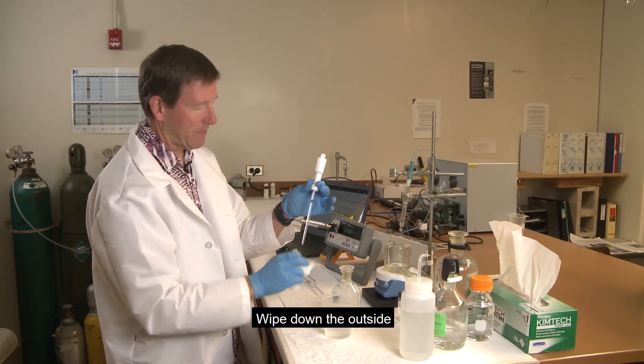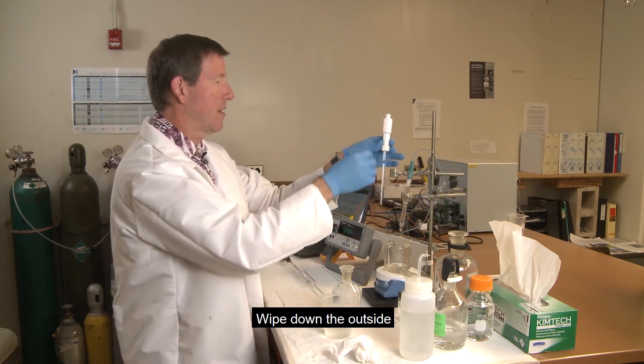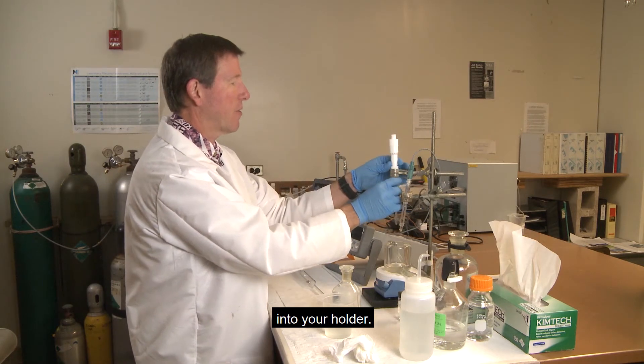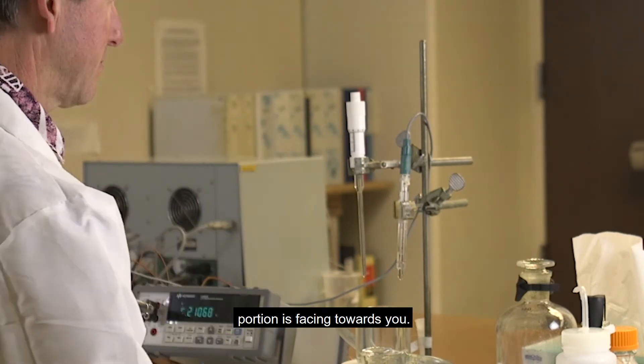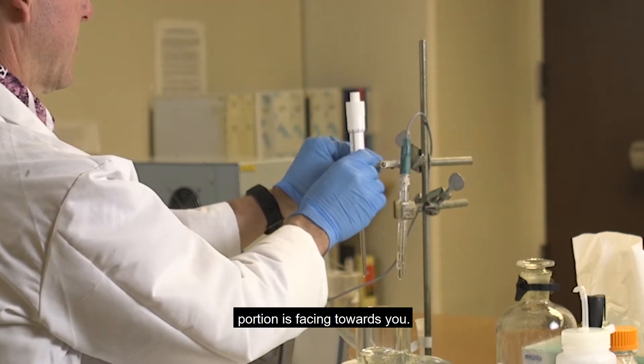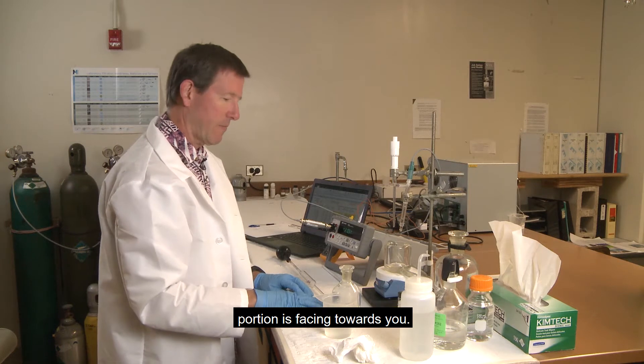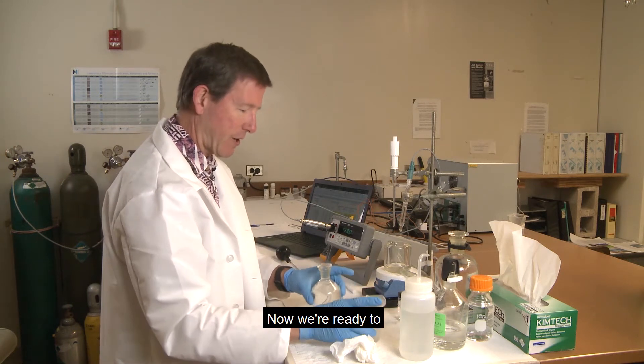Wipe down the outside and then put it back into your holder, making sure that the calibrated portion is facing towards you. Okay, now we're ready to load our sample.